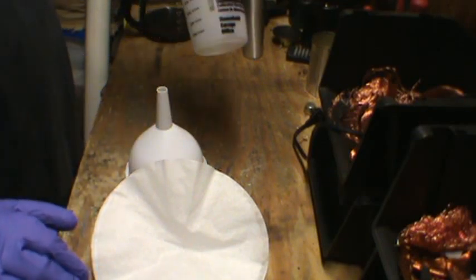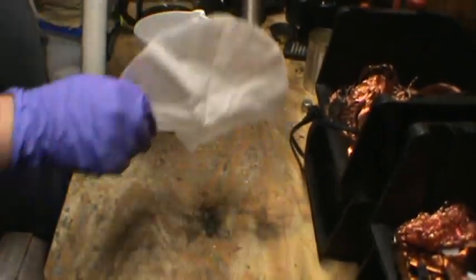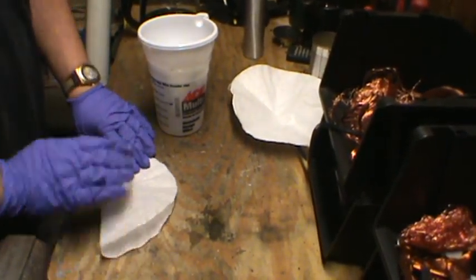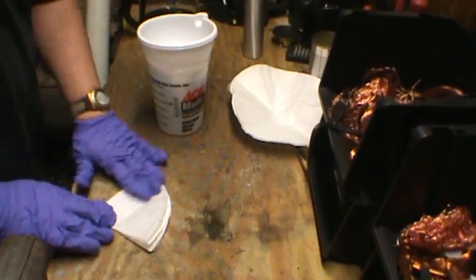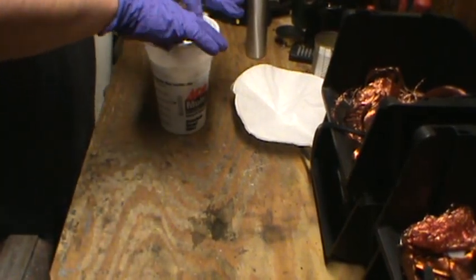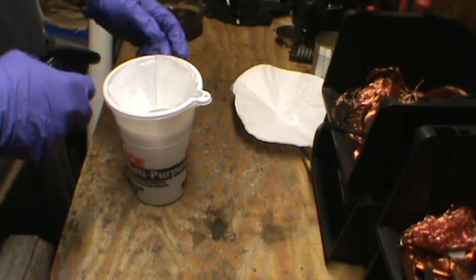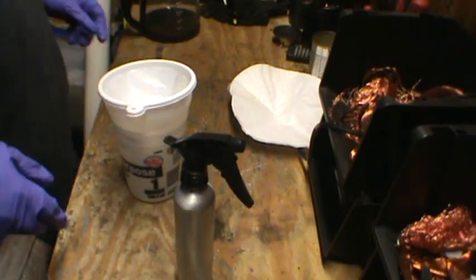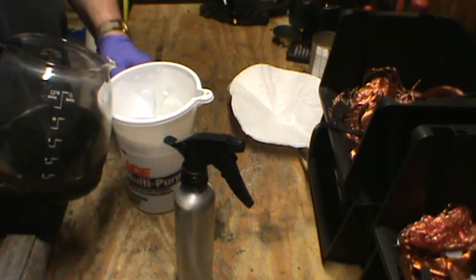Next, what we need is a container, a plastic or glass funnel, and a coffee filter. What you want to do with the filter is lay it flat, fold it over, fold it over again, then open it up and stick it in there. You want to spray it down with a little bit of water so it sticks to the side. Now we're going to try and pour off the solution without getting any gold in there, if possible.